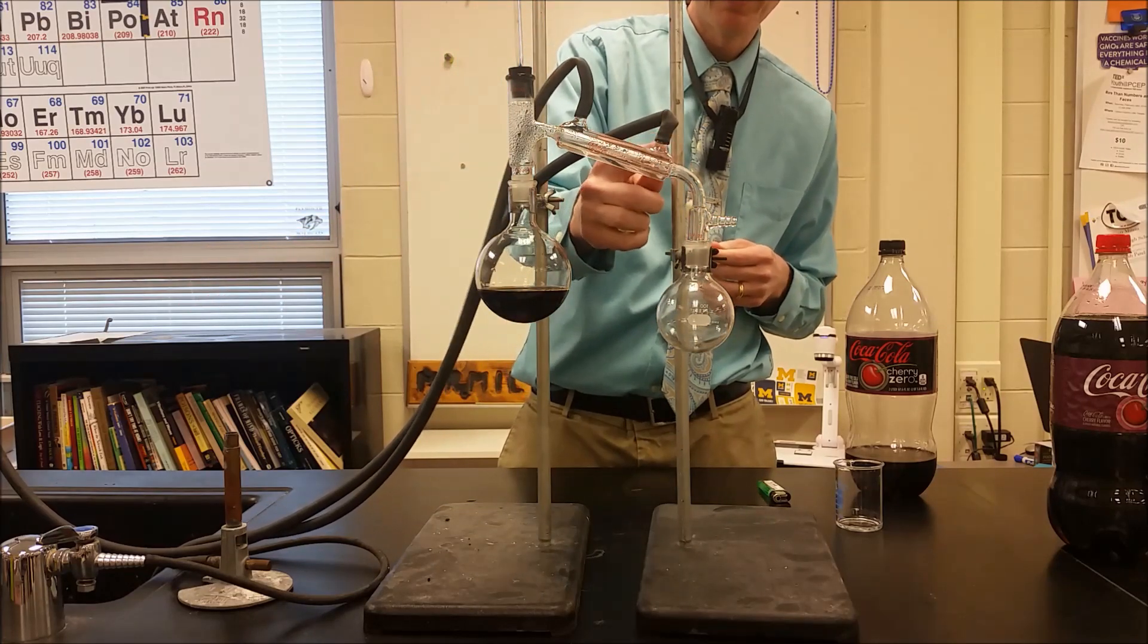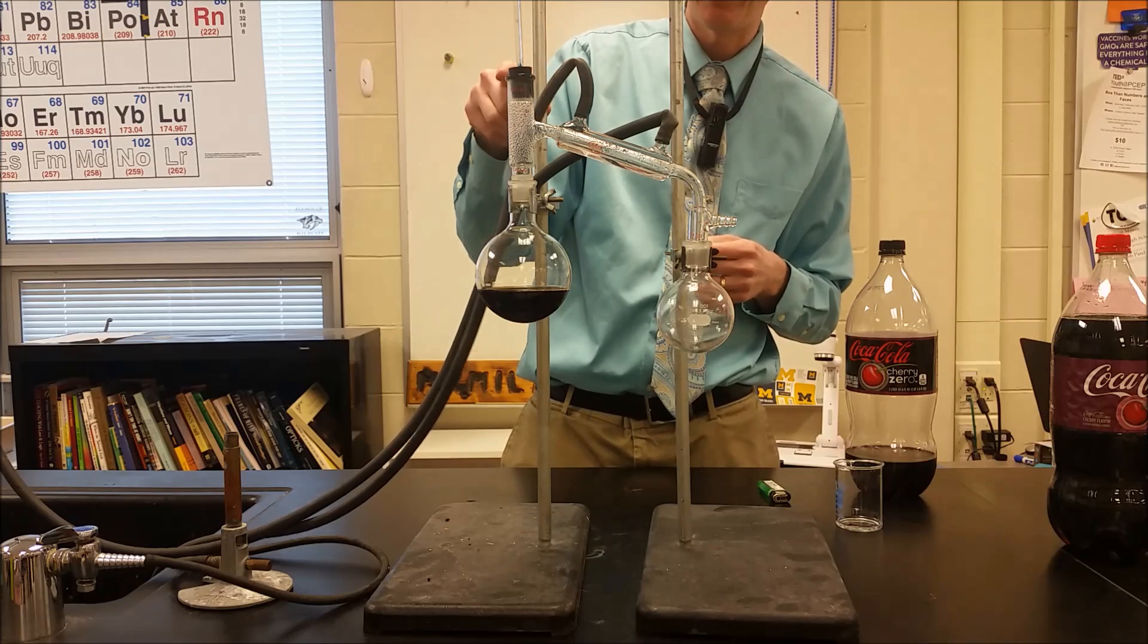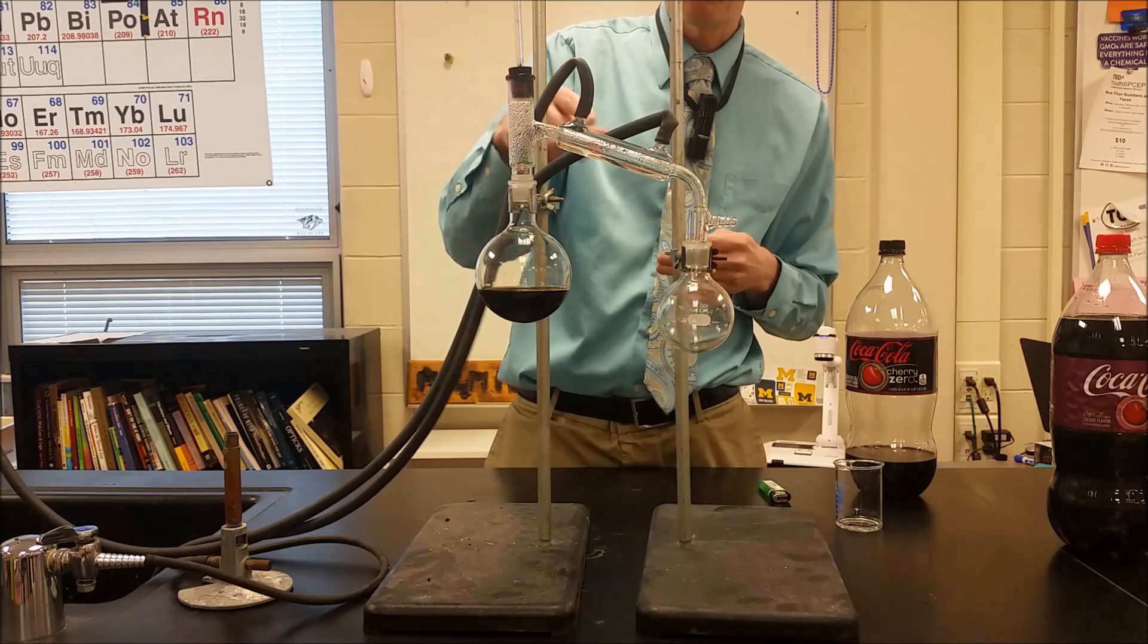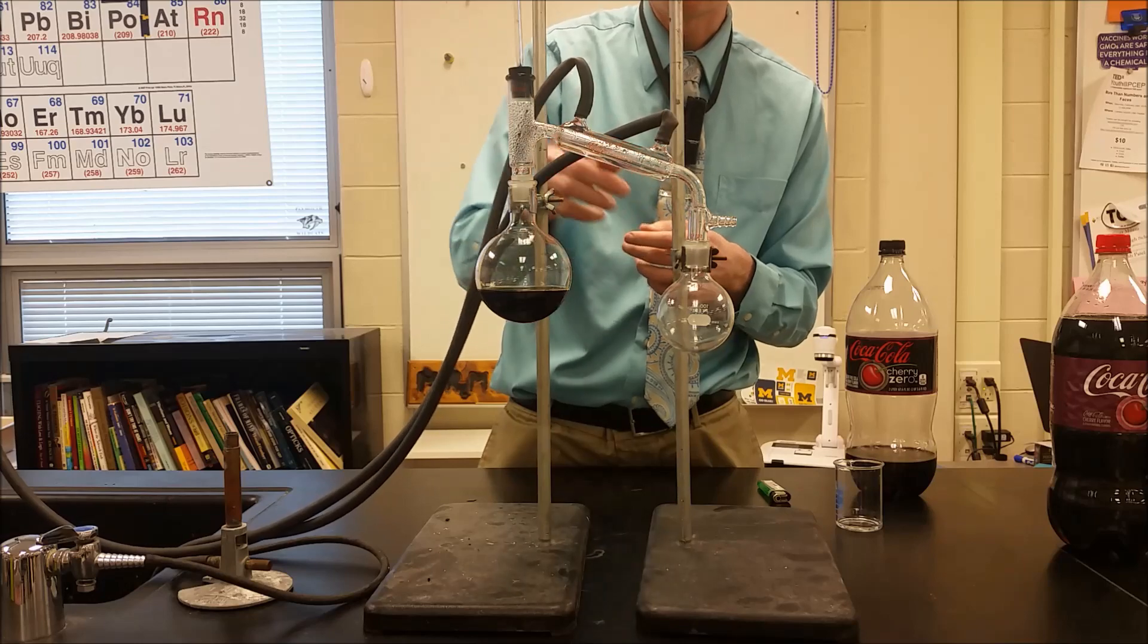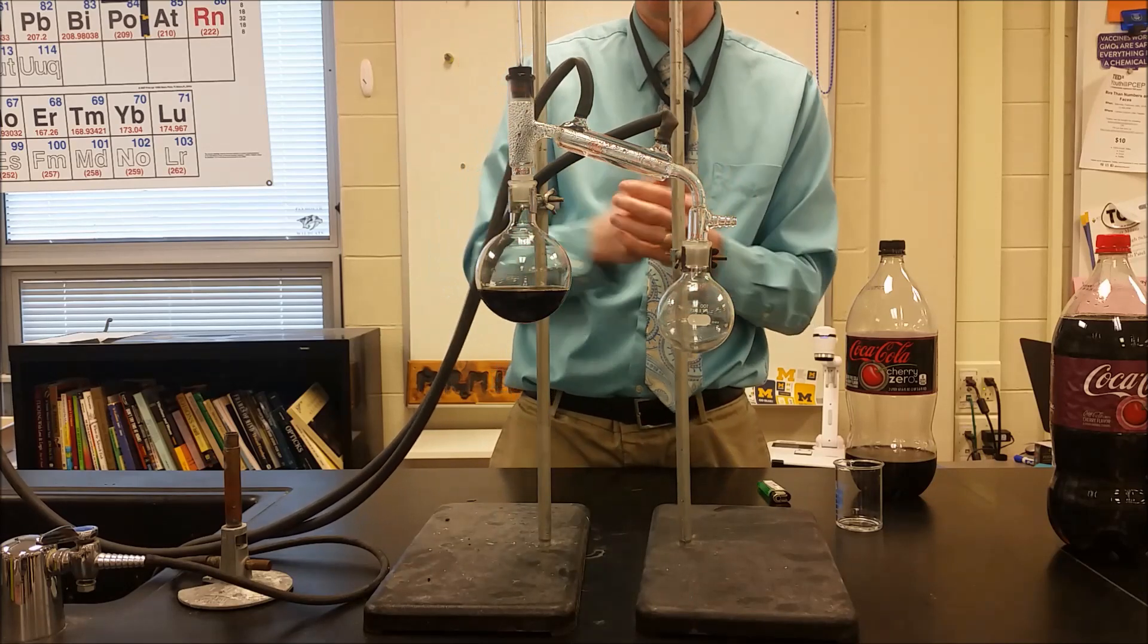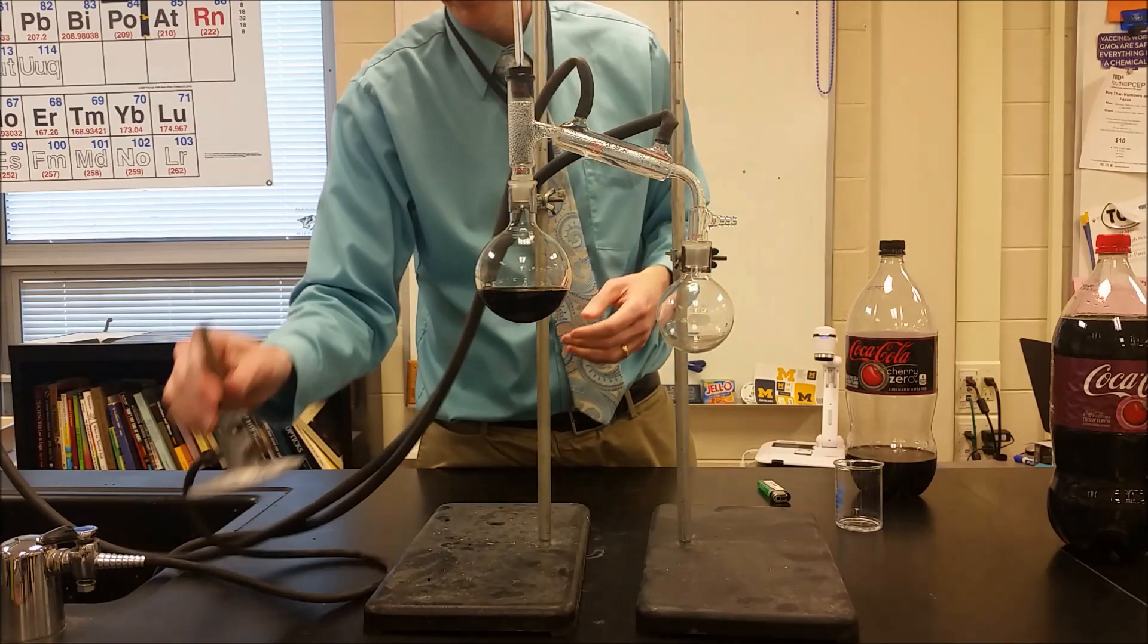So what's happening now is water is coming through this tubing into here and then out through here. And then what's going to happen is it's going to have cold water continually flowing through here to keep cooling down the stuff that we heat.